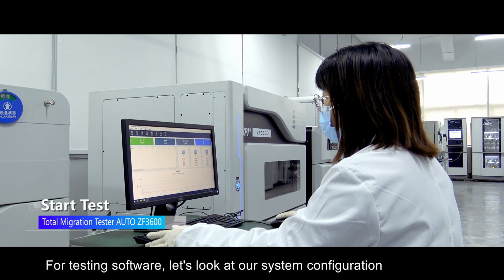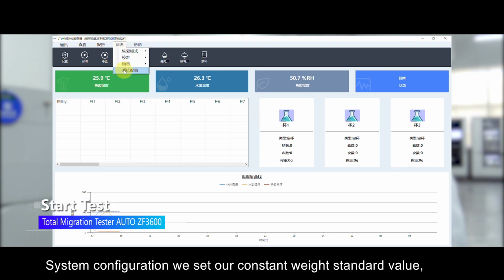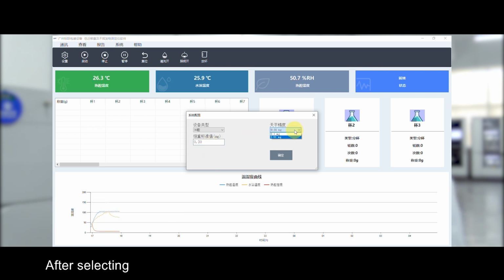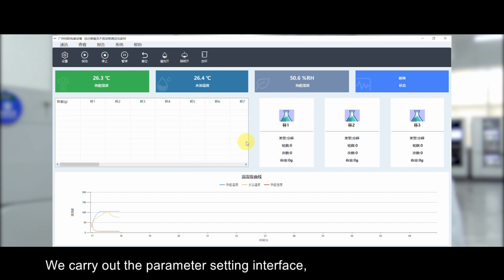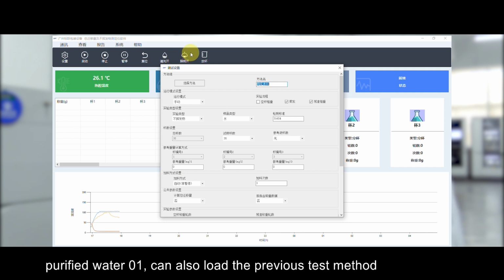For the testing software, let's look at our system configuration. In system configuration, we set our constant weight standard value, and the balance accuracy can be selected between 100,000th and 1/10,000th. After selecting, we go to the parameter setting interface, where we can create a new test method, such as Purified water 01, or load a previous test method.